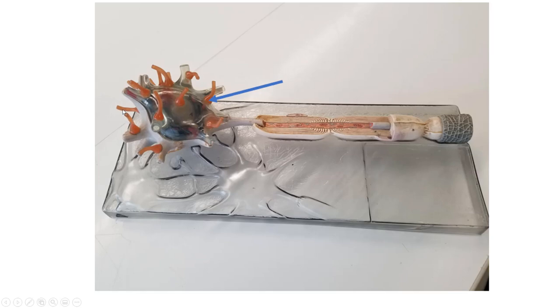What you're looking at here is basically axon terminals from other axons coming in and synapsing here. So this would be a synapse, and remember we had synaptic knobs at the end of the axon terminals. That's what this is. So synaptic knob, then you have this small space, which would be a synapse, and then your dendrite. And so these are all axon terminals coming in from other axons that are going to either stimulate or inhibit this neuron.